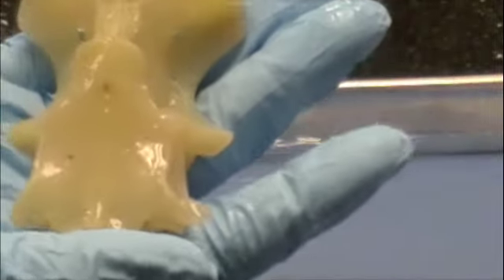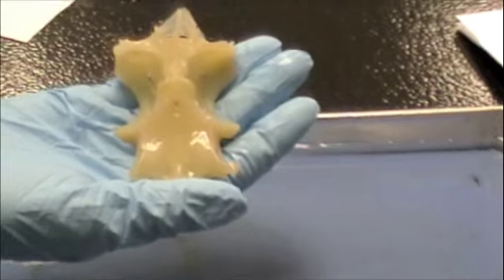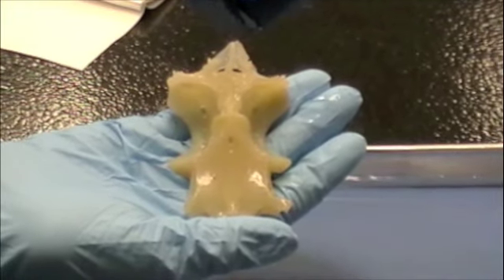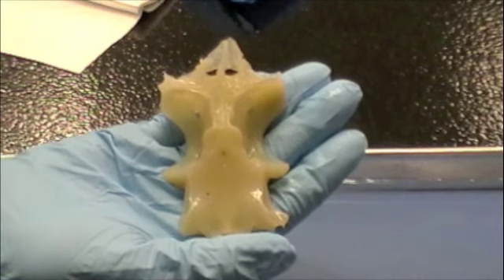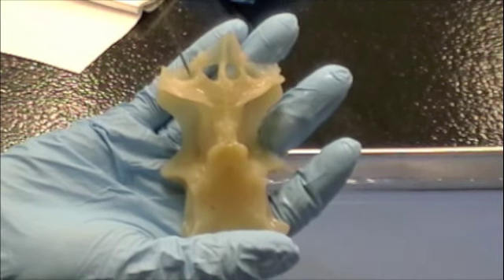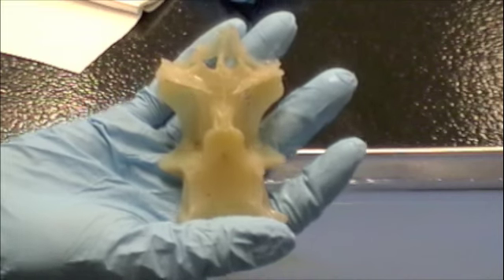Now we're looking at the ventral view. Starting up again: here we have the rostrum, and then the rostral keel. Nasal capsule — I believe these things right here. Nasal capsule. Rostral fenestra.